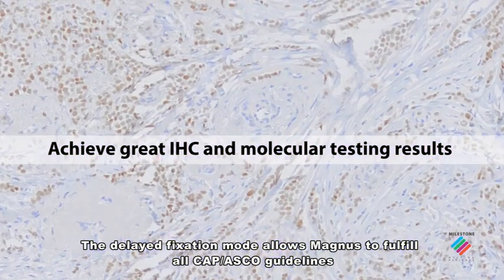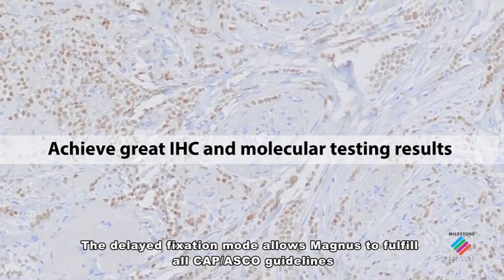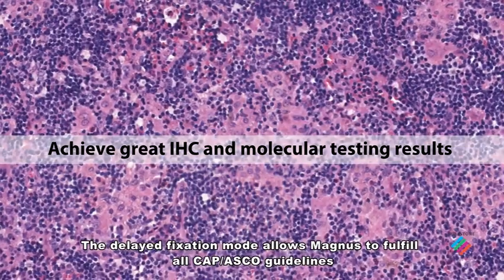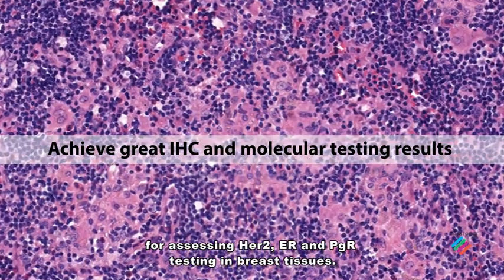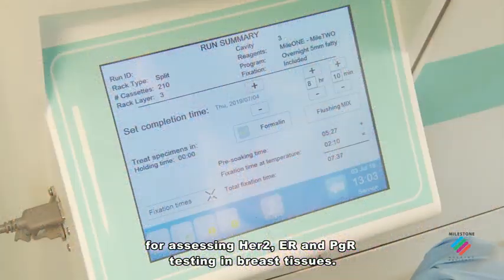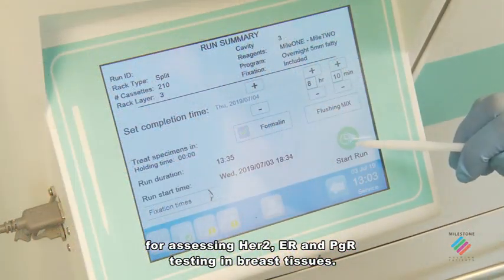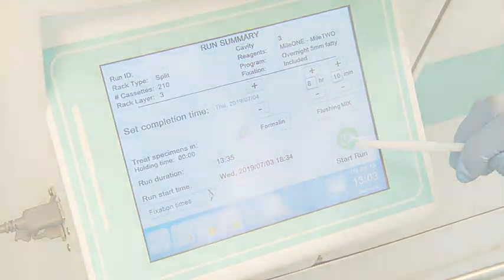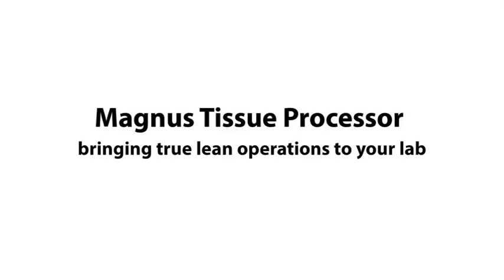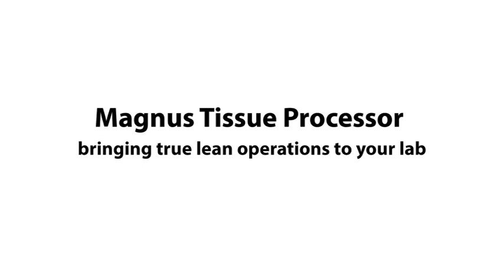The delayed fixation mode allows Magnus to fulfil all CAP-ASCO guidelines for assessing HER2, ER and PGR testing in breast tissues. Magnus Tissue Processor, bringing true lean operations to your lab.